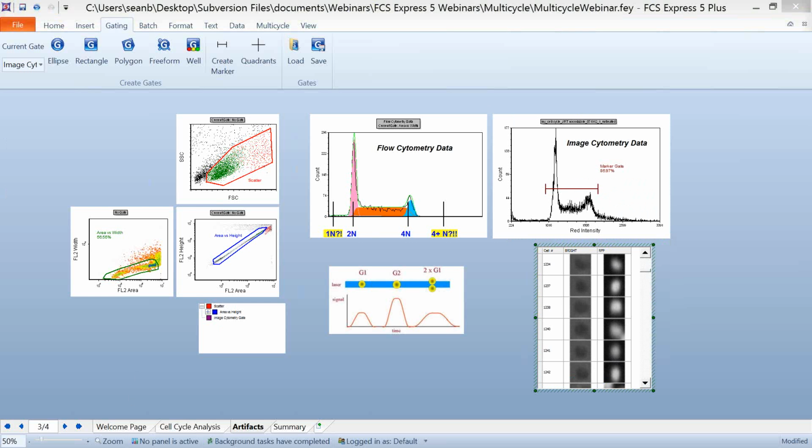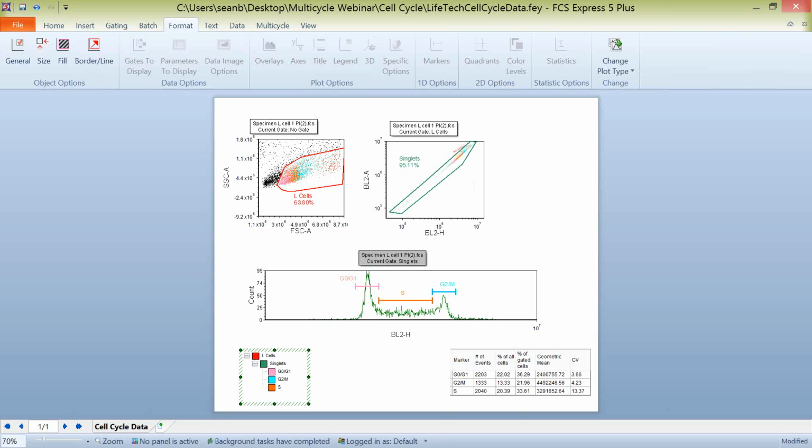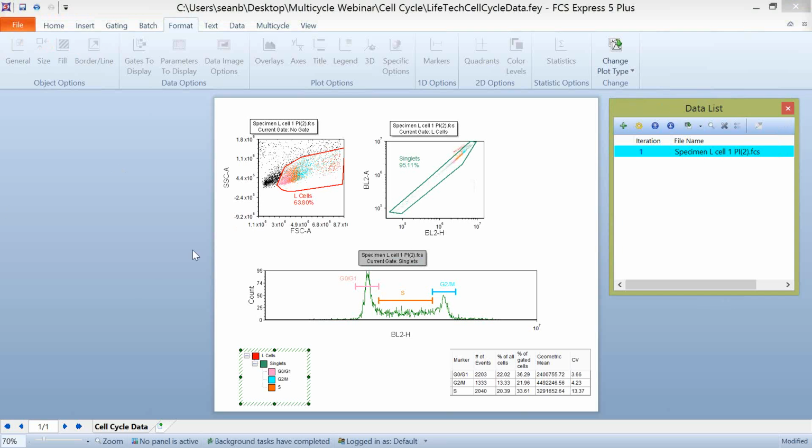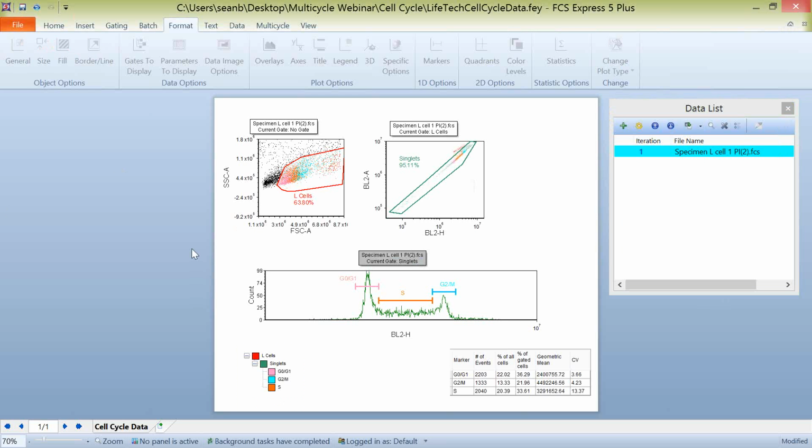So with that being said, we're going to actually go into working with Multicycle in FCS Express. We're going to show you kind of how easy it is to do and some of the things that we can do within Multicycle. So to do so, I'm going to bring up a layout that I've actually started creating. Again, this is a little bit of a more advanced webinar. We're not going to show you how to actually insert standard plots and create gates and gating hierarchies.